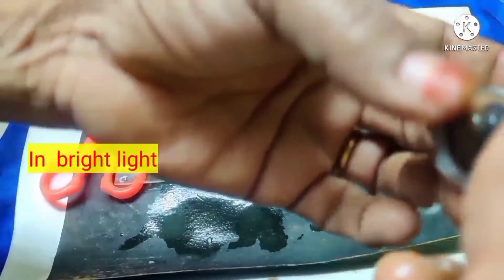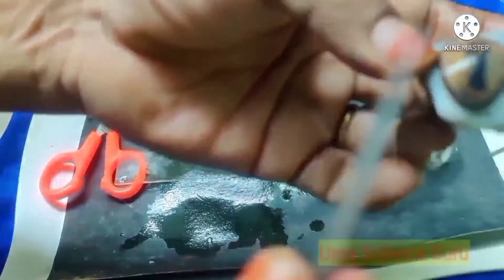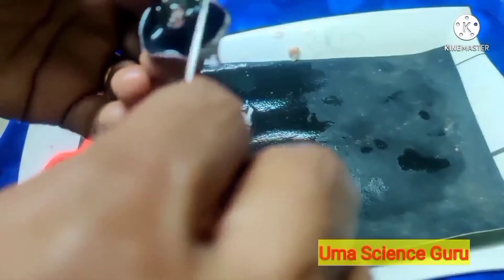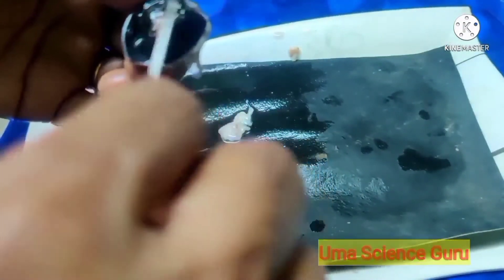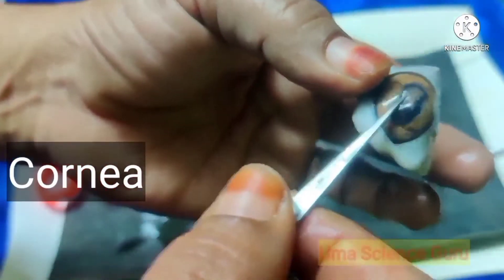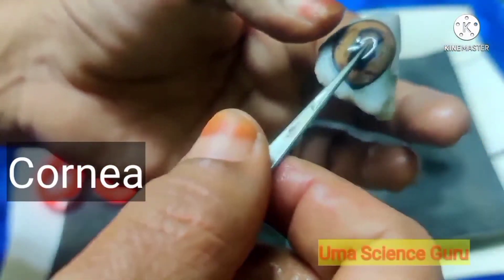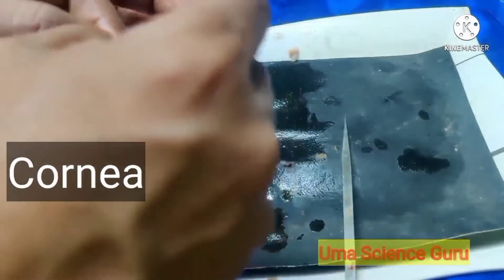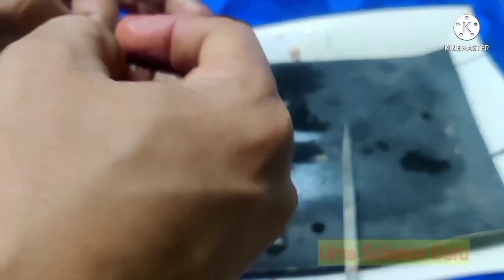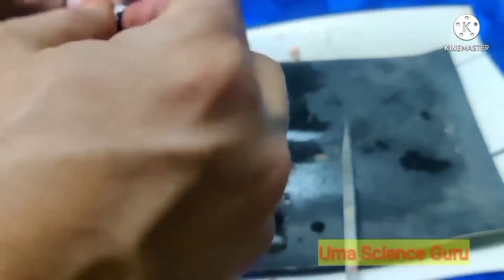When light is bright, the pupil contracts and the aperture becomes small so that less light passes through. The actions of the iris and pupil are comparable to the action of the diaphragm in a camera. The transparent dome-shaped tissue called the cornea extends over the iris and belongs to the sclerotic layer. Let us separate the sclerotic layer from the choroid layer.